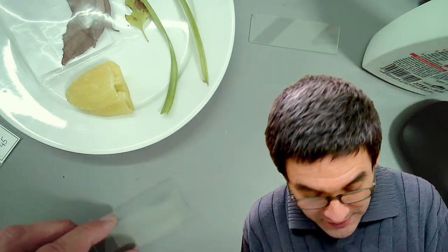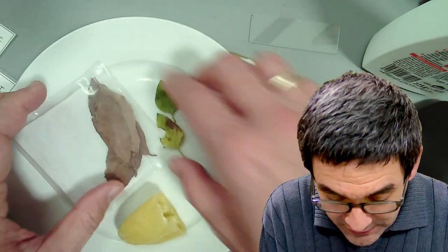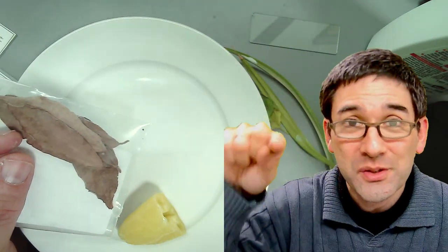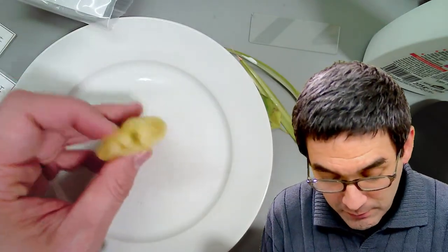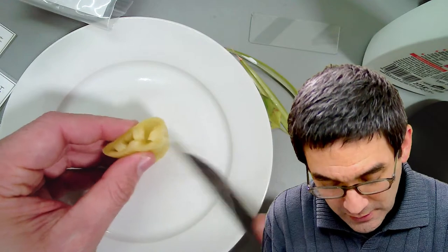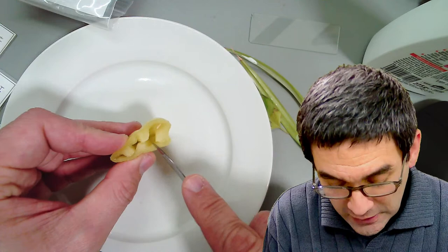What I'm going to do now is show you another nice little experiment. Maybe you're wondering about this strange star-like structure that you saw on the thumbnail at the beginning of the video. That's a so-called trichome. I'm going to show you how to prepare it from a leaf. Here I've got some peppers, some vegetables — it's a little bit dry already. I'm going to show you now a way to prepare this to actually look at some of the plant cells.